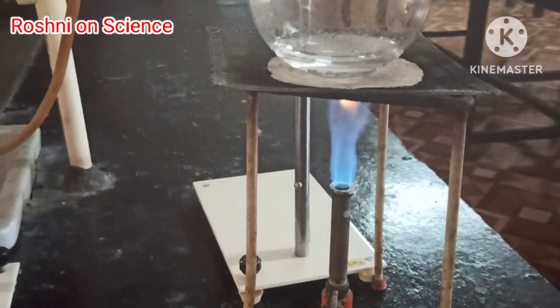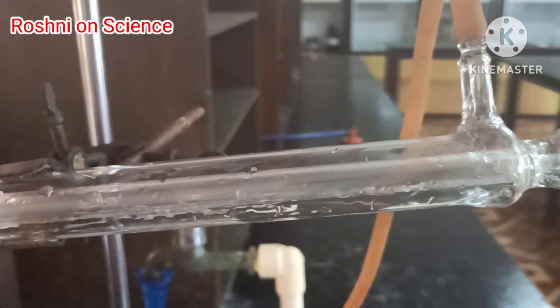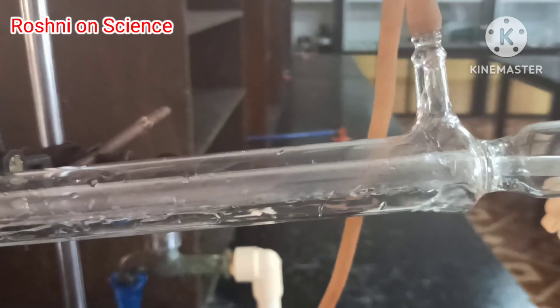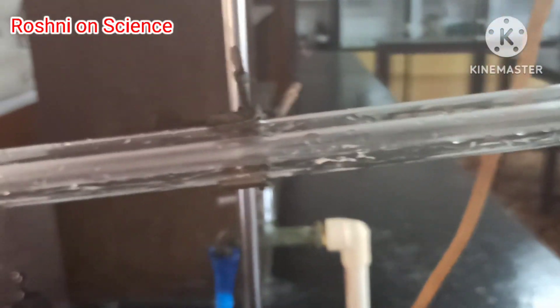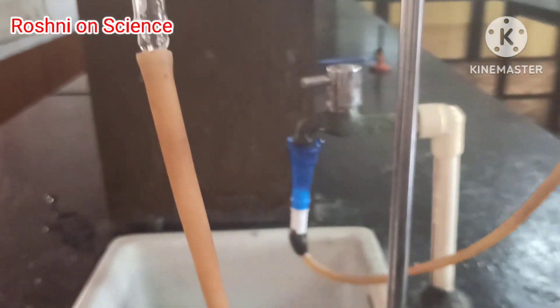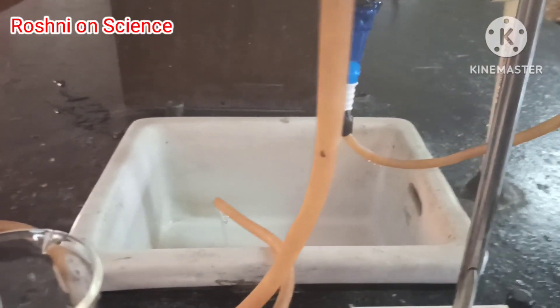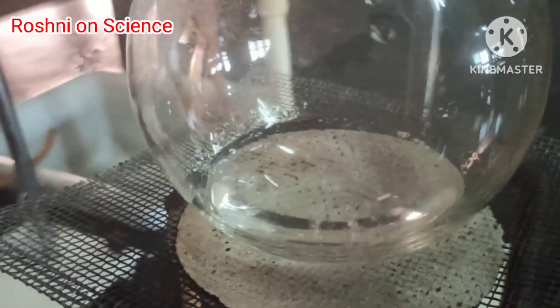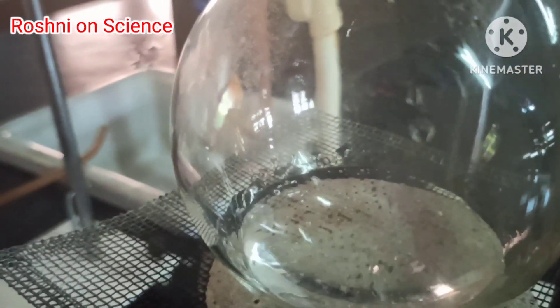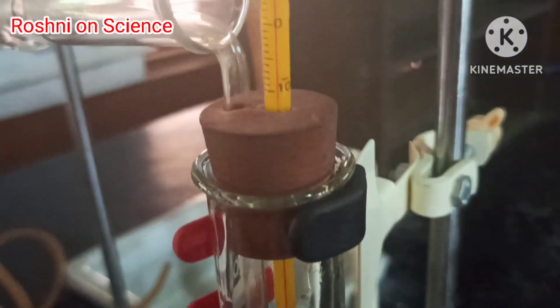Heat the mixture. Pass the cold water through the Liebig condenser. The boiling point of acetone is 56 degrees Celsius, whereas the boiling point of water is 100 degrees Celsius.